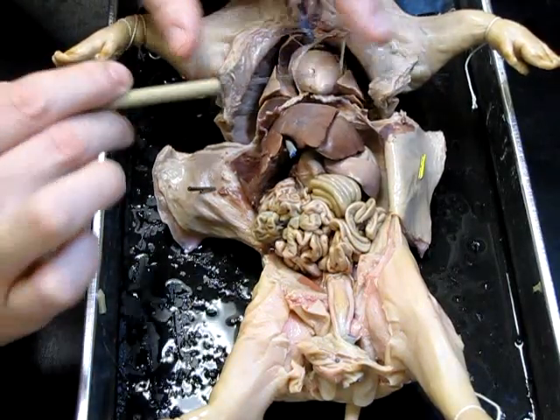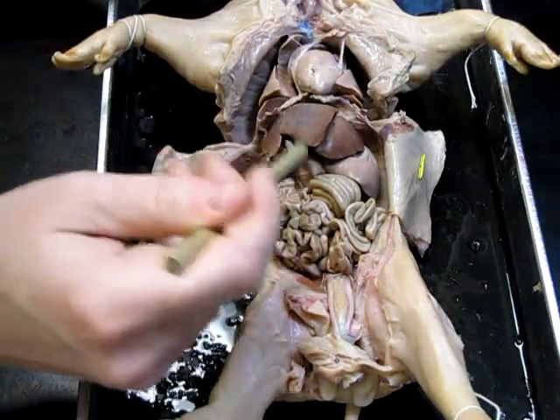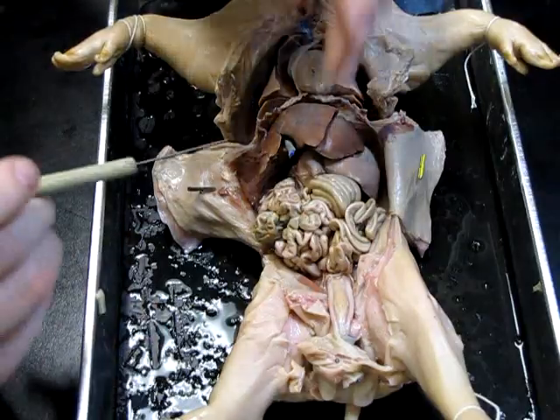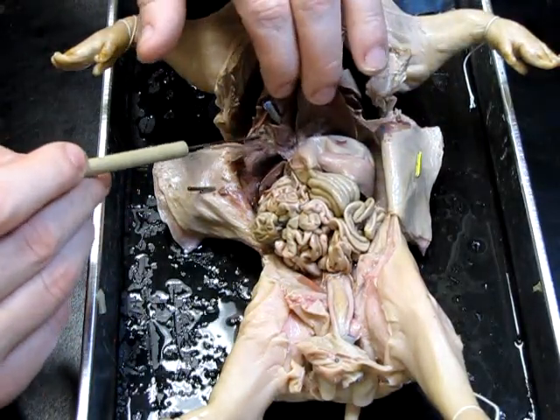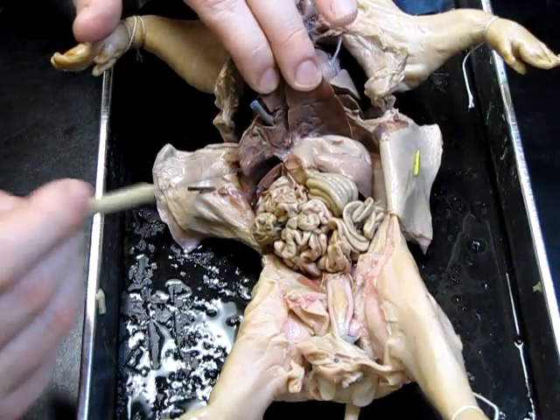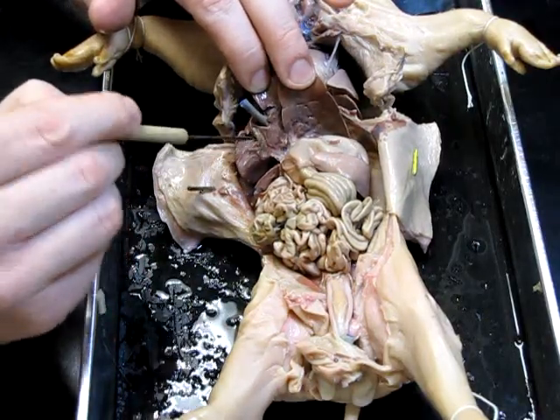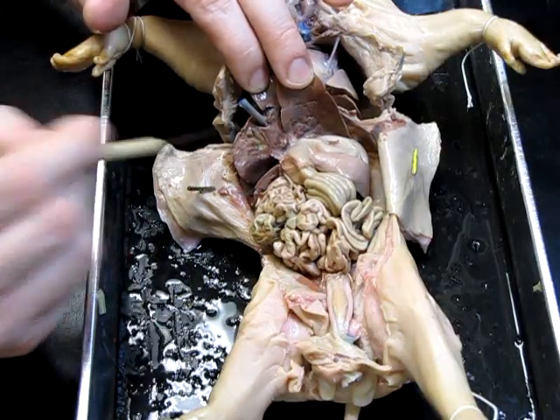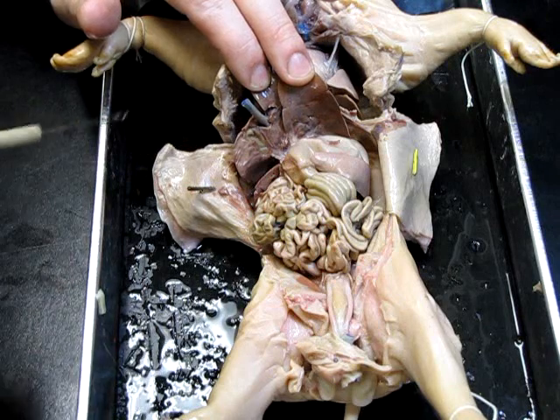Below the diaphragm, the first organ we find is this large multi-lobed structure — this is of course the liver, which produces bile, which is involved in the breakdown of fat. Bile is stored in a small sack underneath the liver. We can see it right here, this little bag — that is the gallbladder.